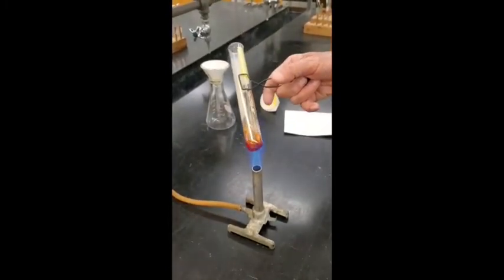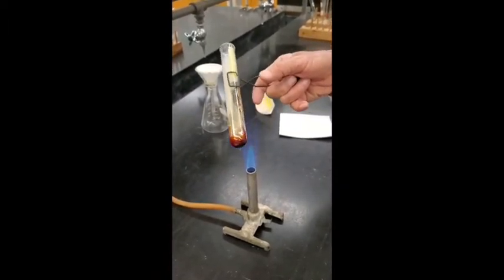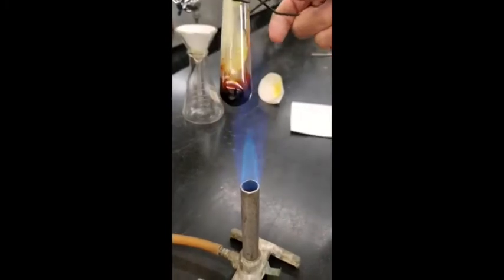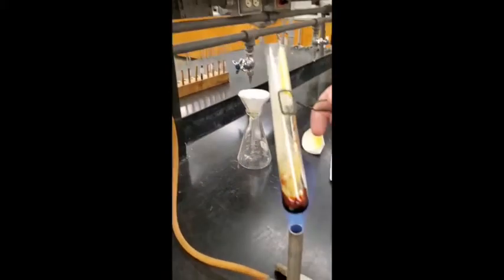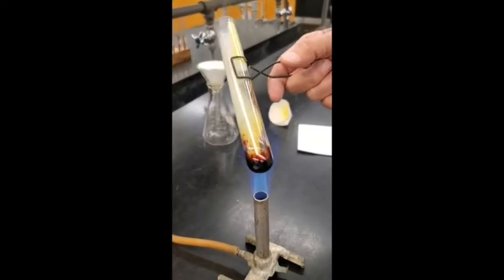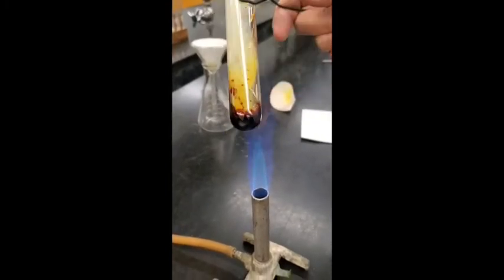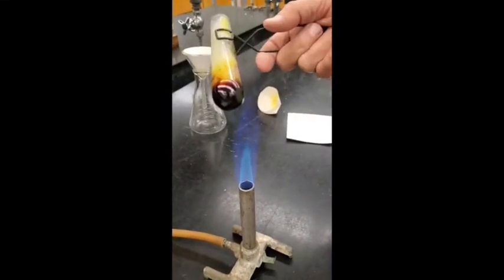Can you see it's getting darker in color? What's happening is we're breaking up the S8 molecules and making chains of sulfur atoms. It's getting dark in color because at the ends of the chains you have free radicals, and they absorb light. You can't pour it now — it's very viscous. That's because the chains are all tangled up. If you heat it more strongly, the chains will break up into shorter chains and then you can flow it — it flows better and I can pour it out. See, it's already starting to flow a little better.